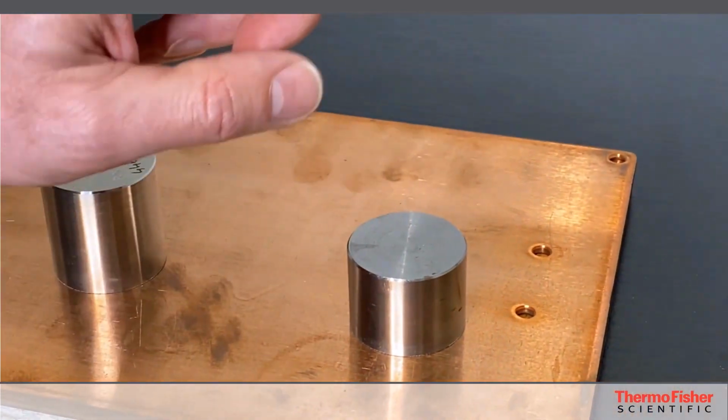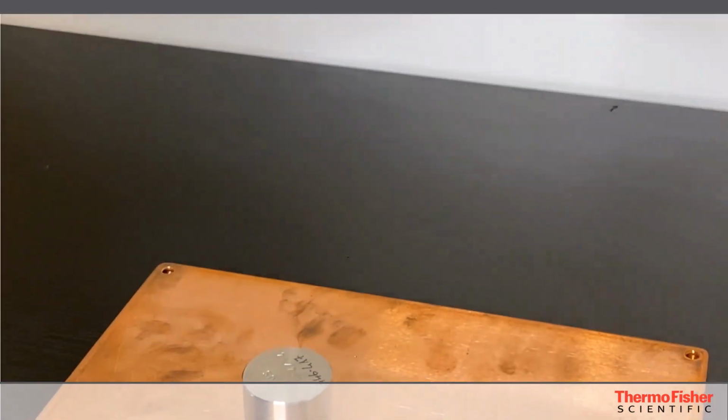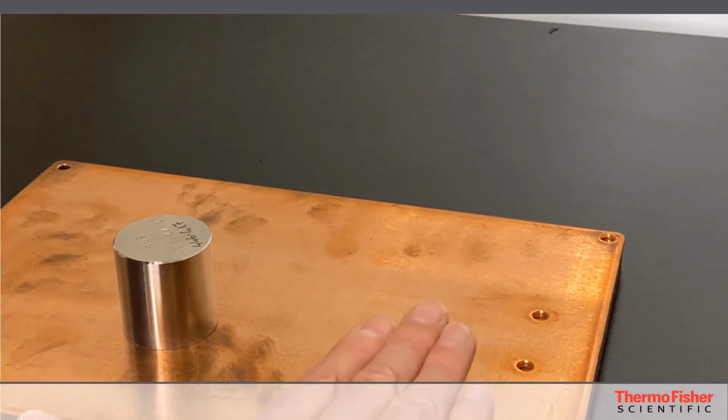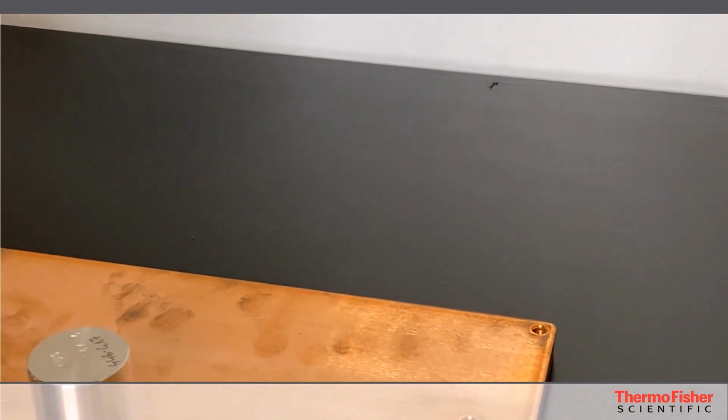But we have one last step to do. We're going to have to resurface this just really quickly, a quick pass on it, because we don't want it in contact with the cooling plate, the copper plate, before we analyze it, because that's the analysis surface.